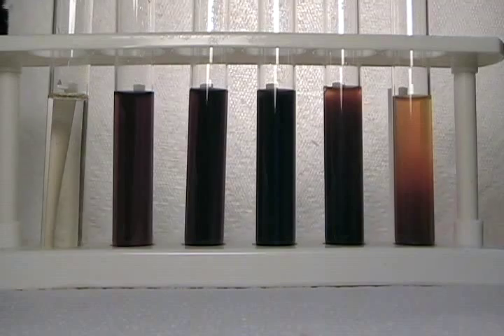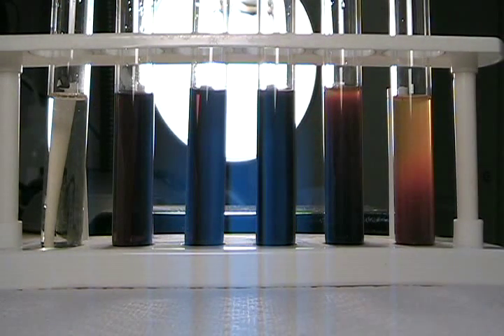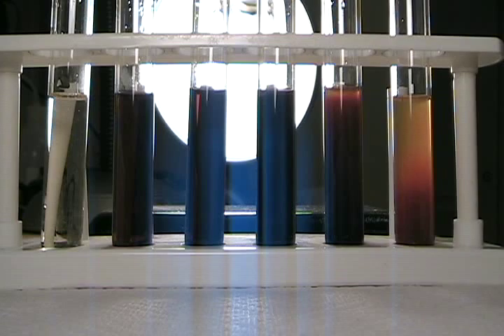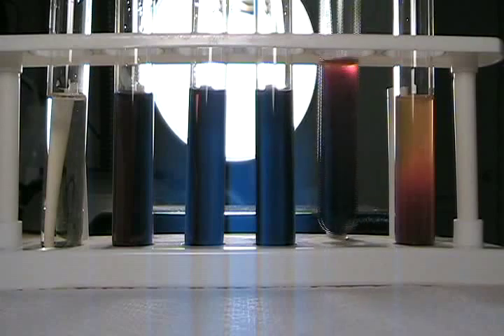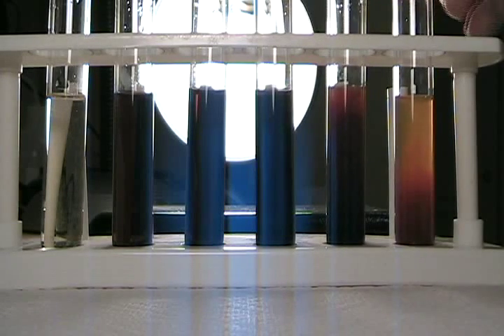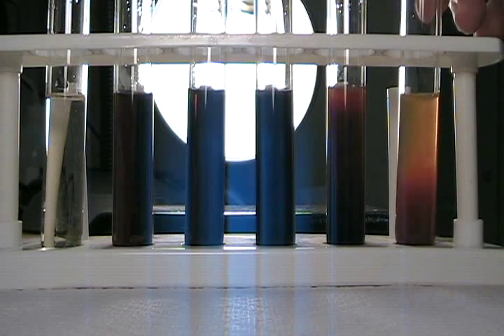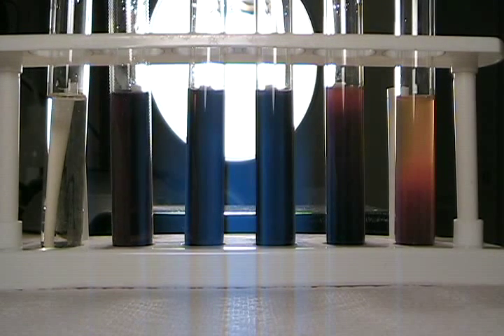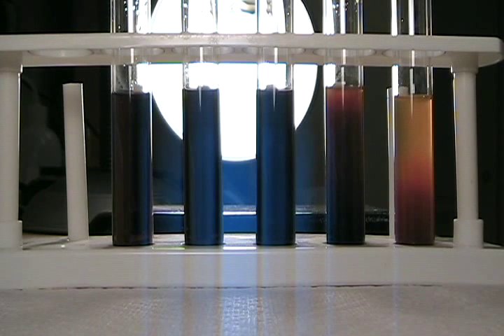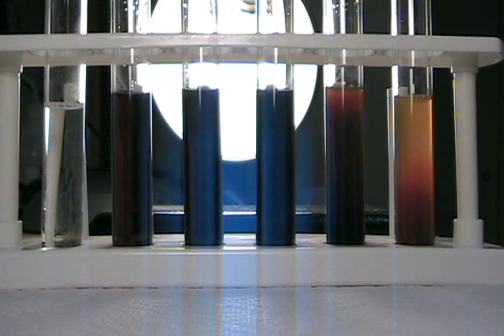I'll remove this paper towel and see if we can see more difference in the coloration by looking directly through the tubes — and we can. The two rightmost test tubes apparently contain sufficient hydroxide ion that we're actually getting an iron hydroxide precipitate, causing a brownish coloration as opposed to the purple visible in the other tubes. I'm now going to remove the control tube from the rack and replace it with another tube containing 10 ml of urine.